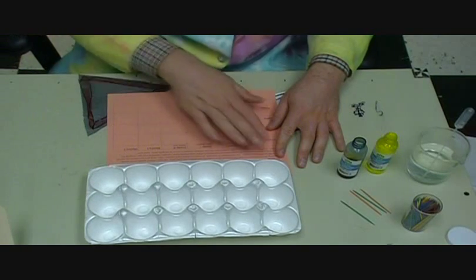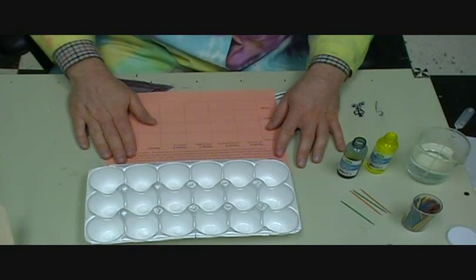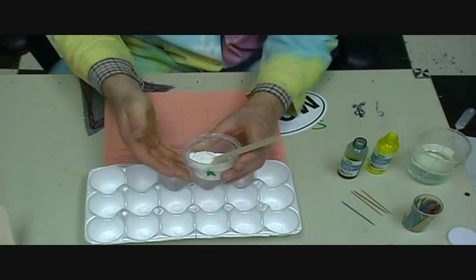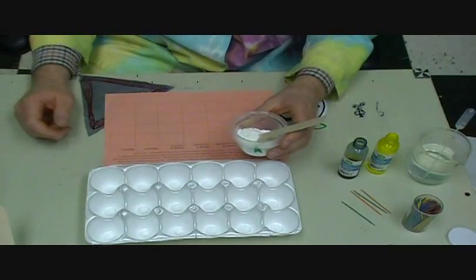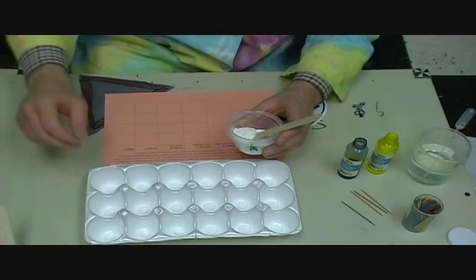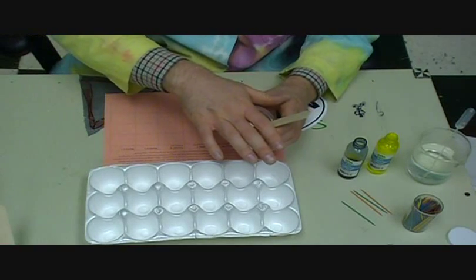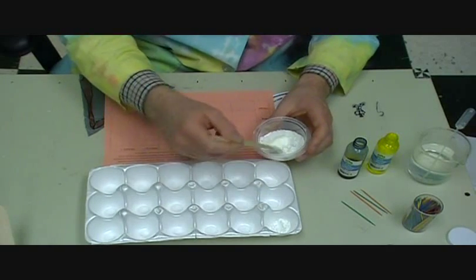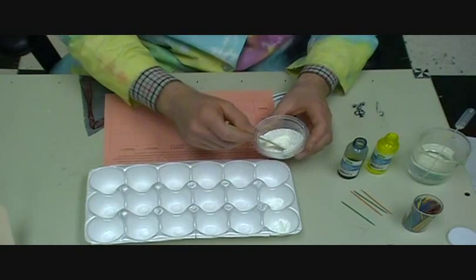Now the worksheet explains what the students are doing again, and then you'll just need to have these containers of the powders in a central location. And I don't want the students to take the mystery powders until they've tested the other powders. So all they'll need is just a little bit of it. So they're going to put a little bit of A in each one of these first ones.